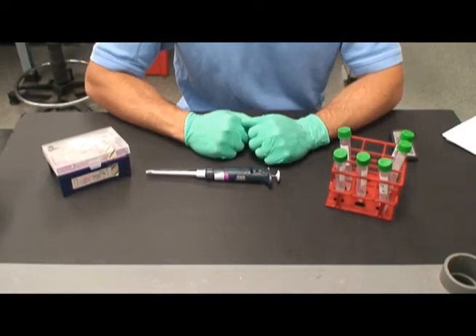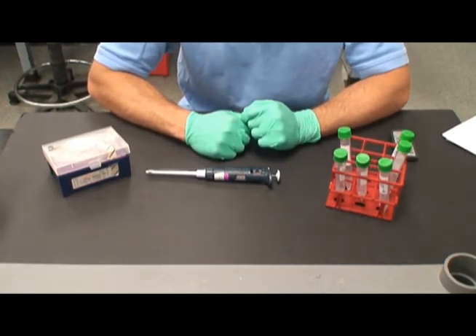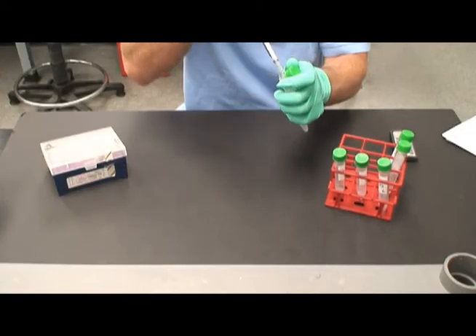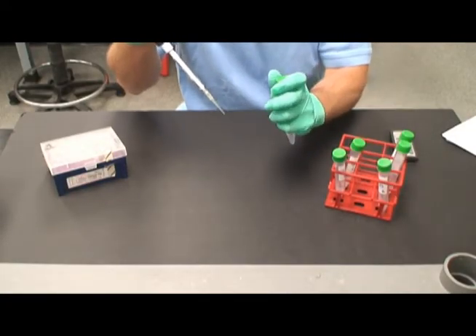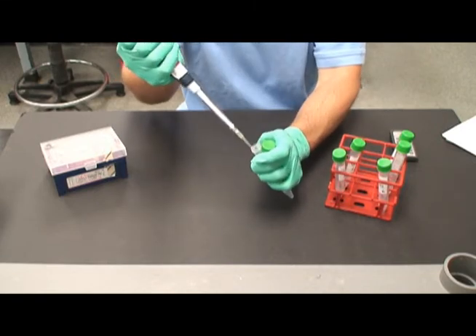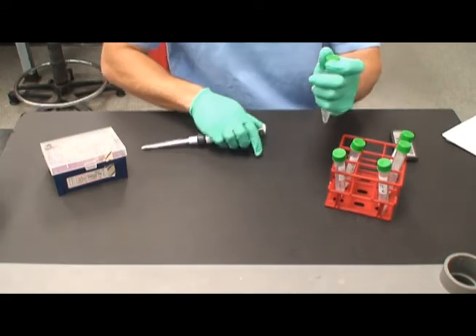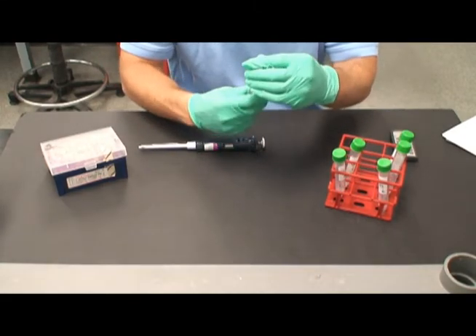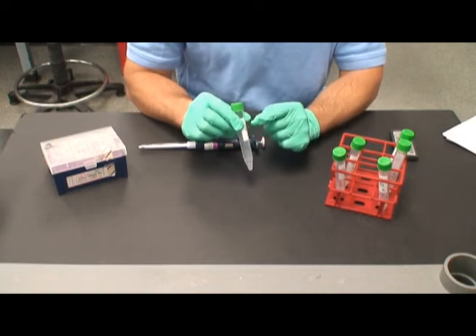100 microliters from the minus 4 tube will now be transferred into the minus 5 tube. This corresponds with a 10-fold dilution. Remember to use the micropipette to flush the liquid up and down in the test tube, as well as vortex after each dilution. Continue these 10-fold dilutions with the 10 to the minus 6, 7, and 8 tubes.